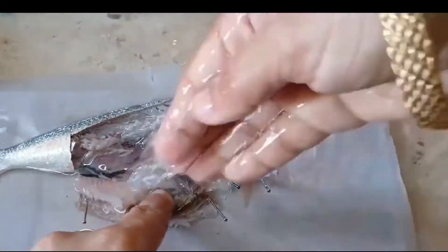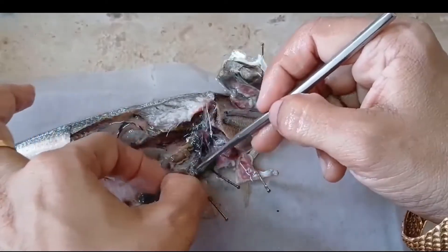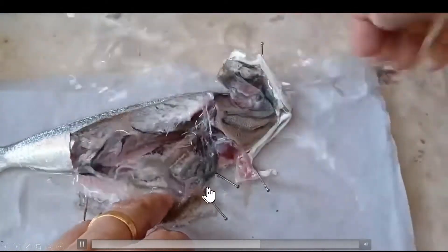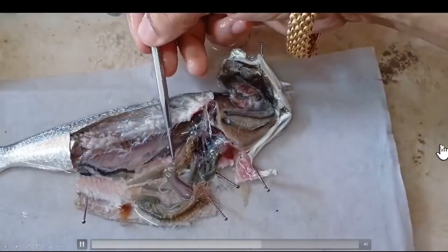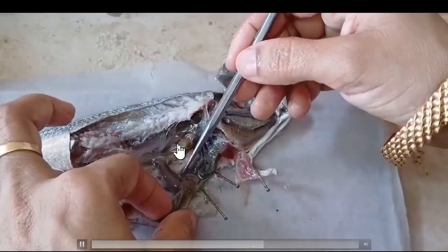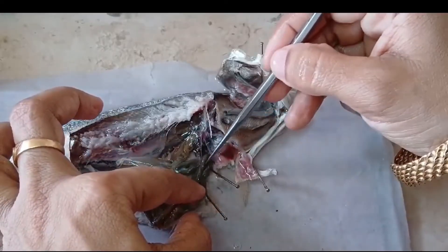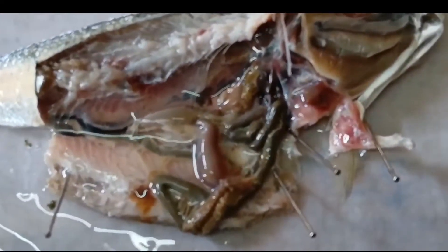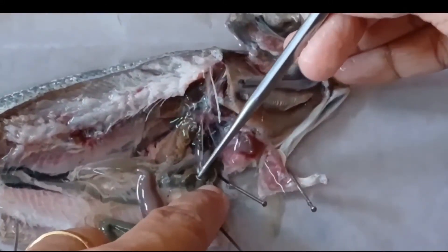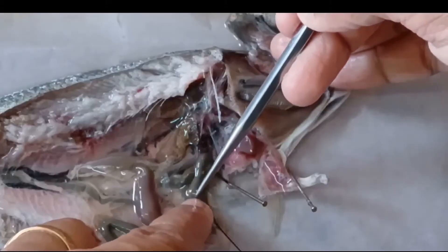It's almost uncoiled — still there are some portions of membrane remaining. Here, as you look, you can see the pyloric caeca in this region. This is the bend — you can clearly see the bend portion here. There is another tangled portion of intestine, and we can still see some membrane that we need to remove in order to spread it neatly and have a good view.